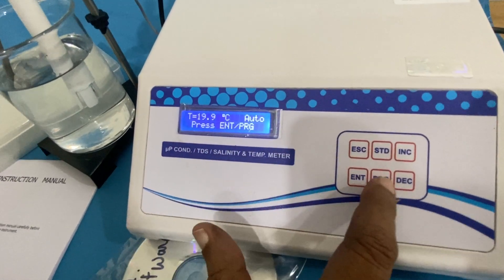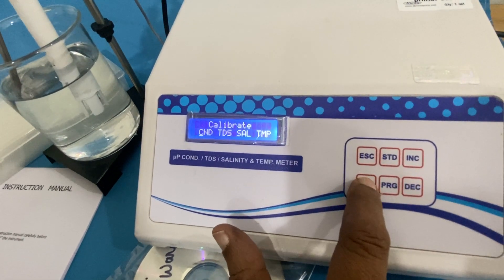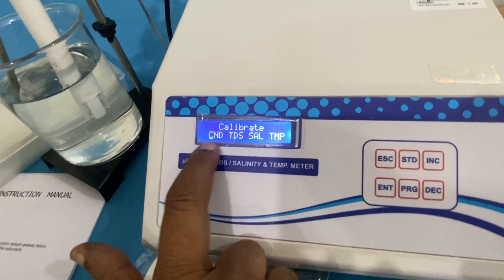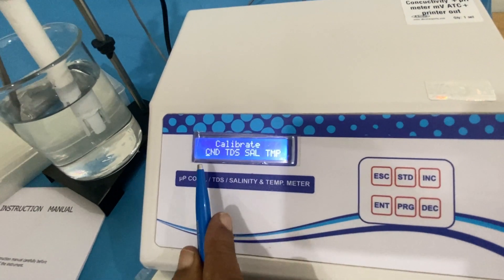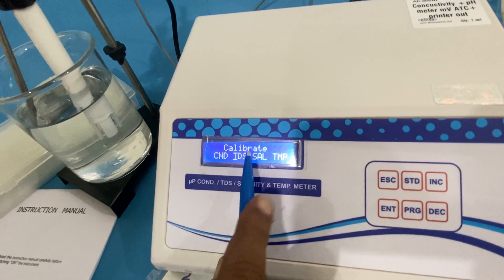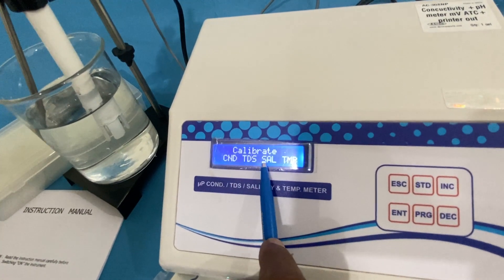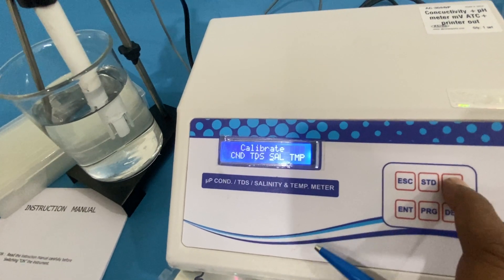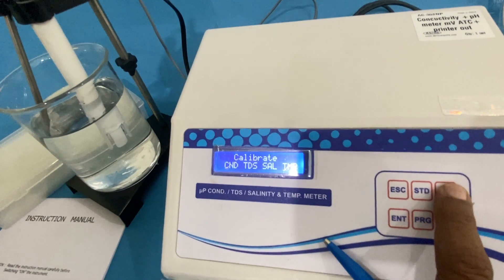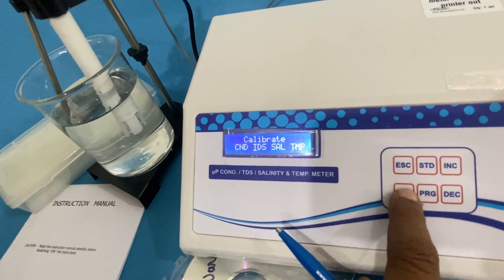Press enter and then program to enter the program mode, then escape. It tells you the conductivity mode now. The cursor below tells you this is in conductivity mode. The other modes are TDS mode, salinity mode, and temperature mode. Whatever mode you want to select — suppose I select TDS now — you press enter.